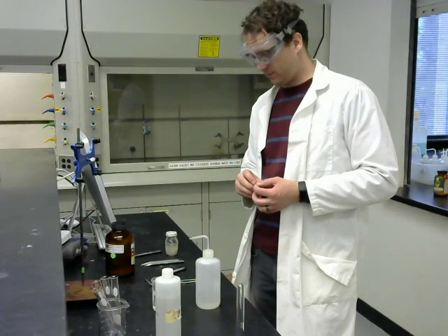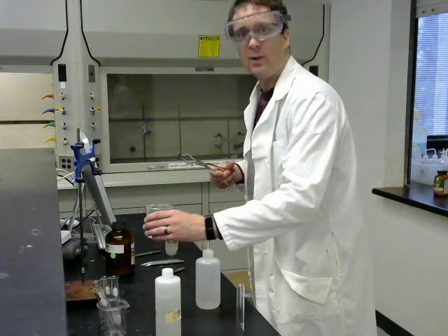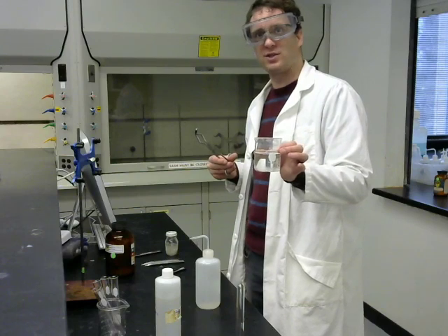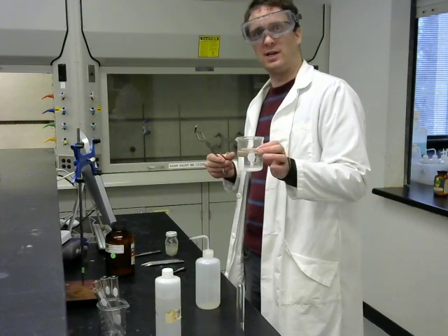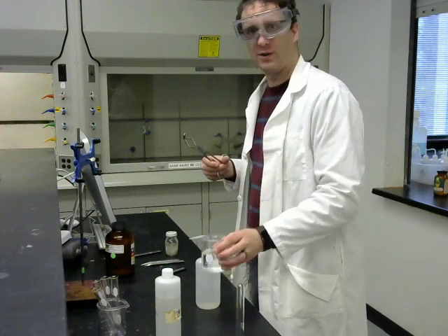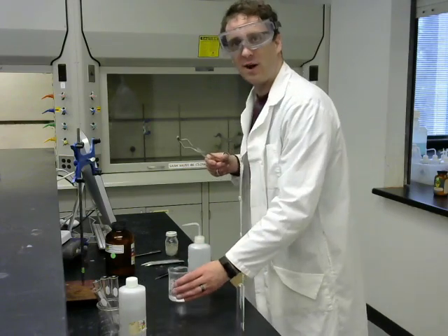Okay, now we're going to be reacting metals with acid. So for this first one, I've prepared here a 1 molar solution of hydrochloric acid. Now you were asked to calculate exactly how much of the 6 molar hydrochloric acid you need to use, diluting it to a total final volume of 150 milliliters to make 1 molar hydrochloric acid. And I'll leave that to you to do those calculations yourself. So this is our 1 molar acid.